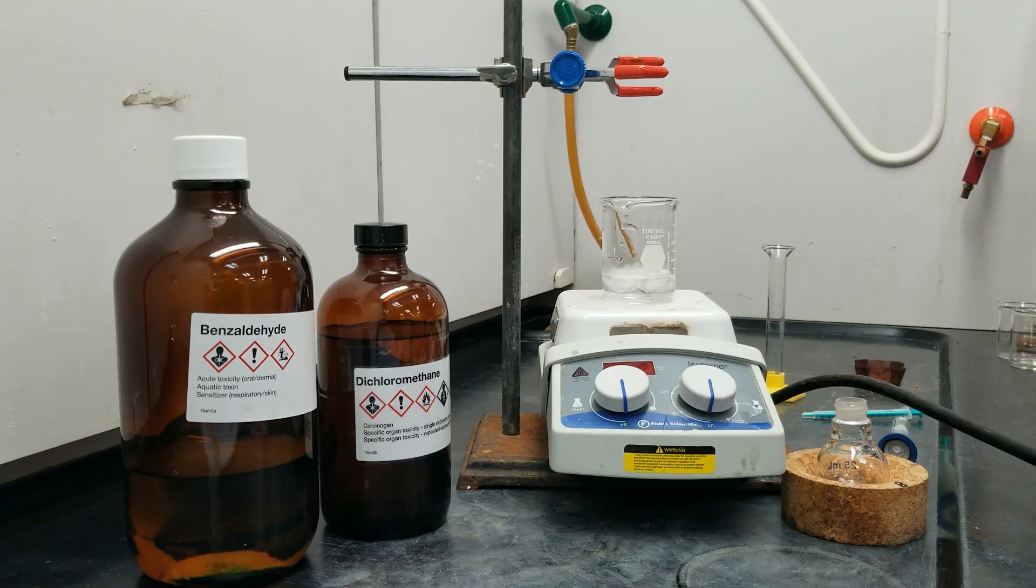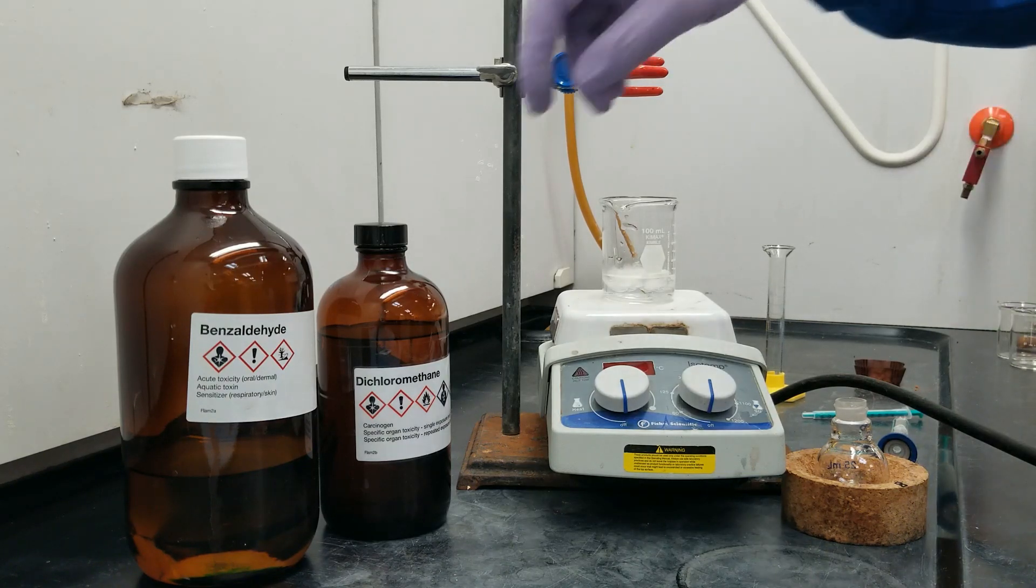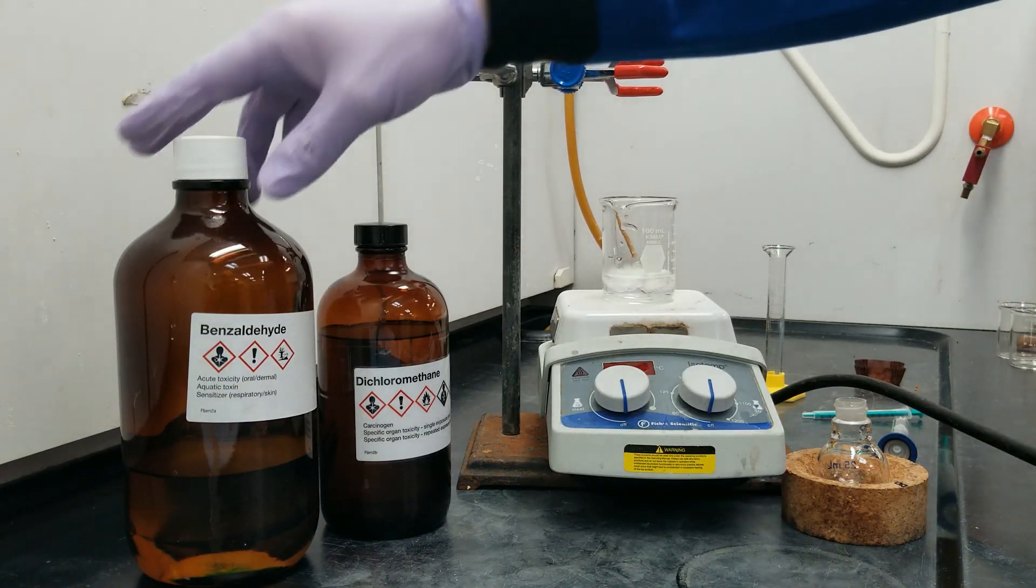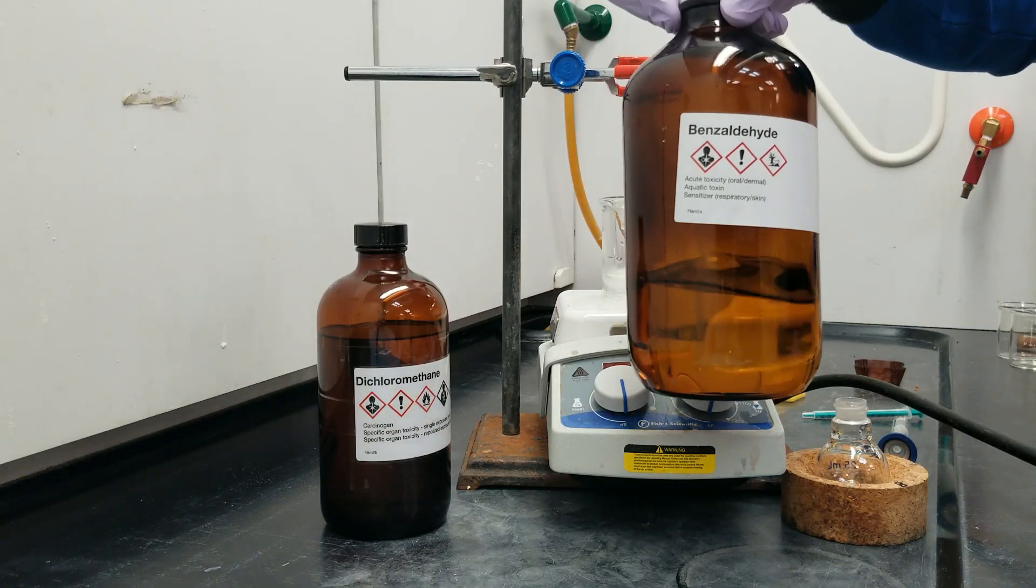Hi everyone. So today I'm going to be showing you the Wittig reaction. The reagents that we're going to be using today, I'm going to start with benzaldehyde.